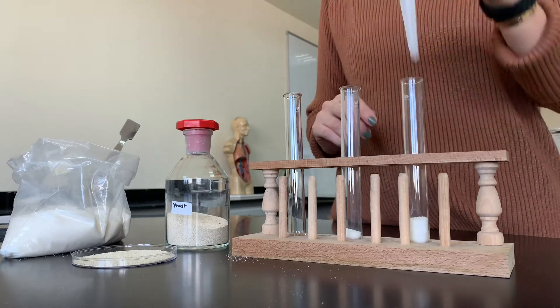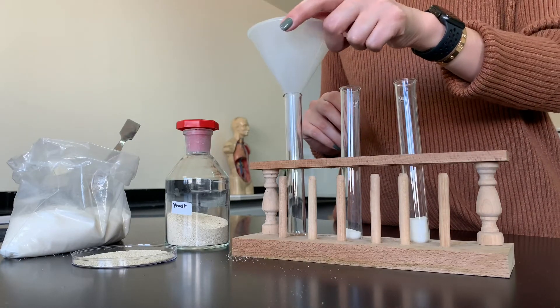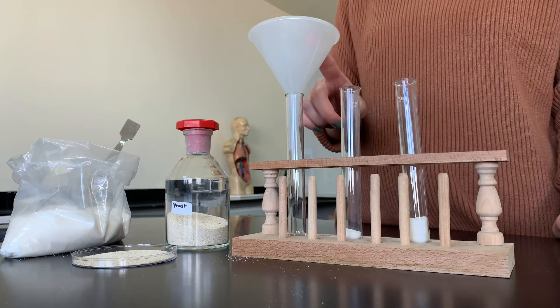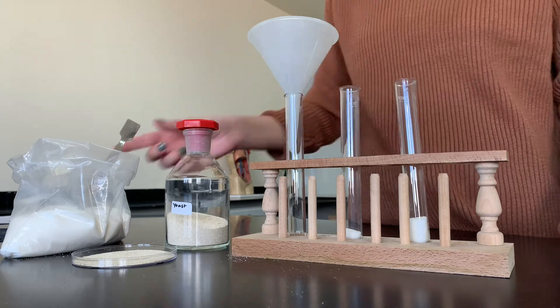Next I'm going to be adding equal amounts of yeast to each of the test tubes, one teaspoon of yeast to each.